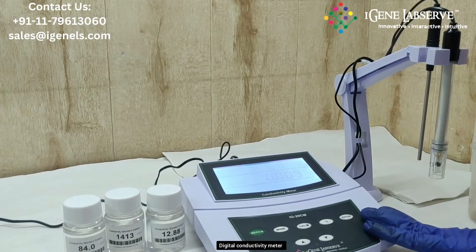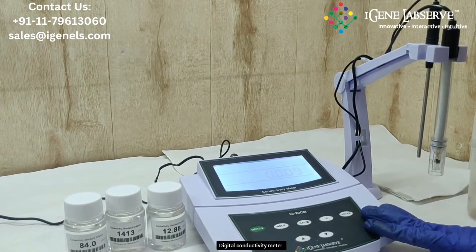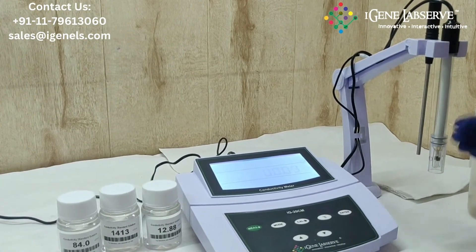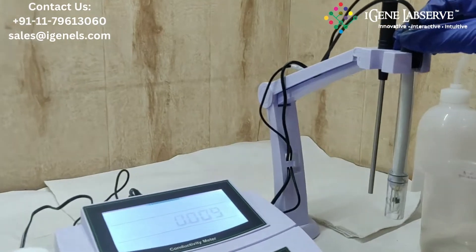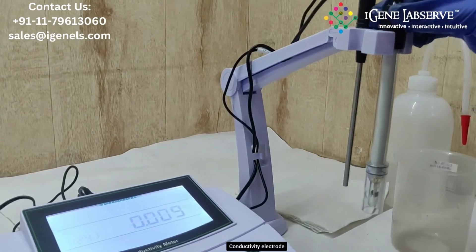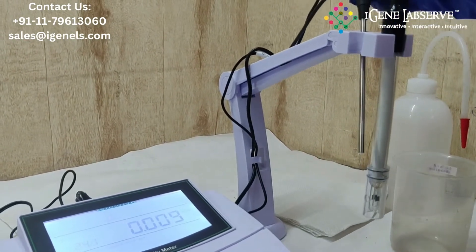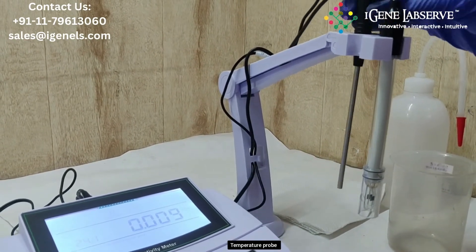This is iGene's conductivity meter. It comes with a conductivity electrode as well as a temperature probe.